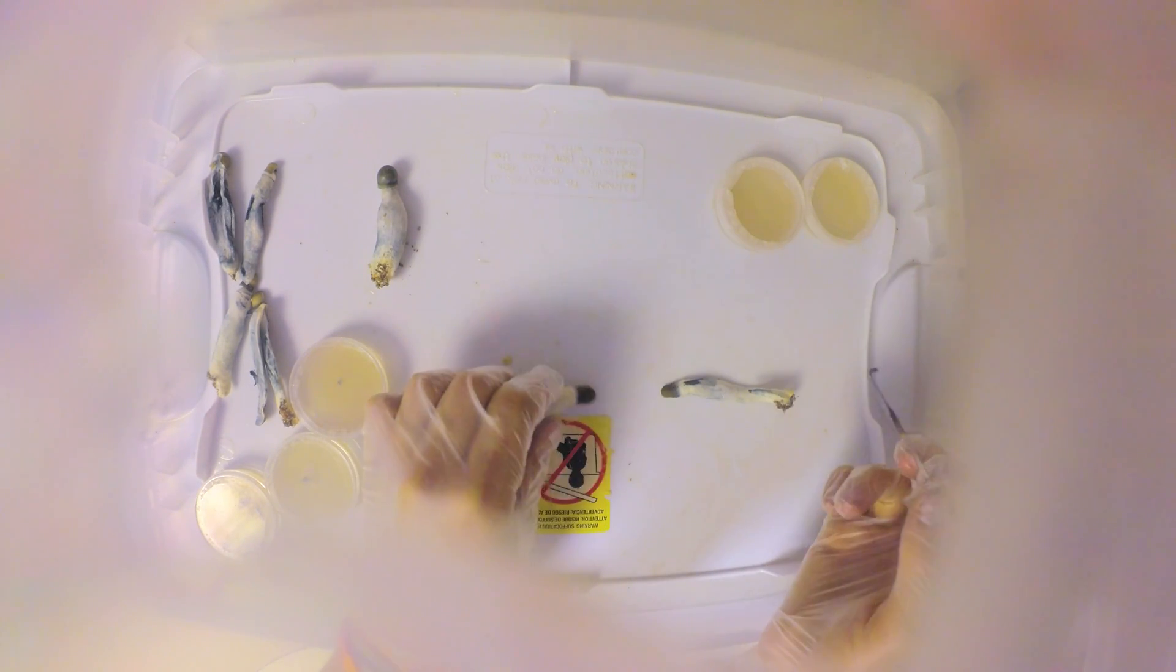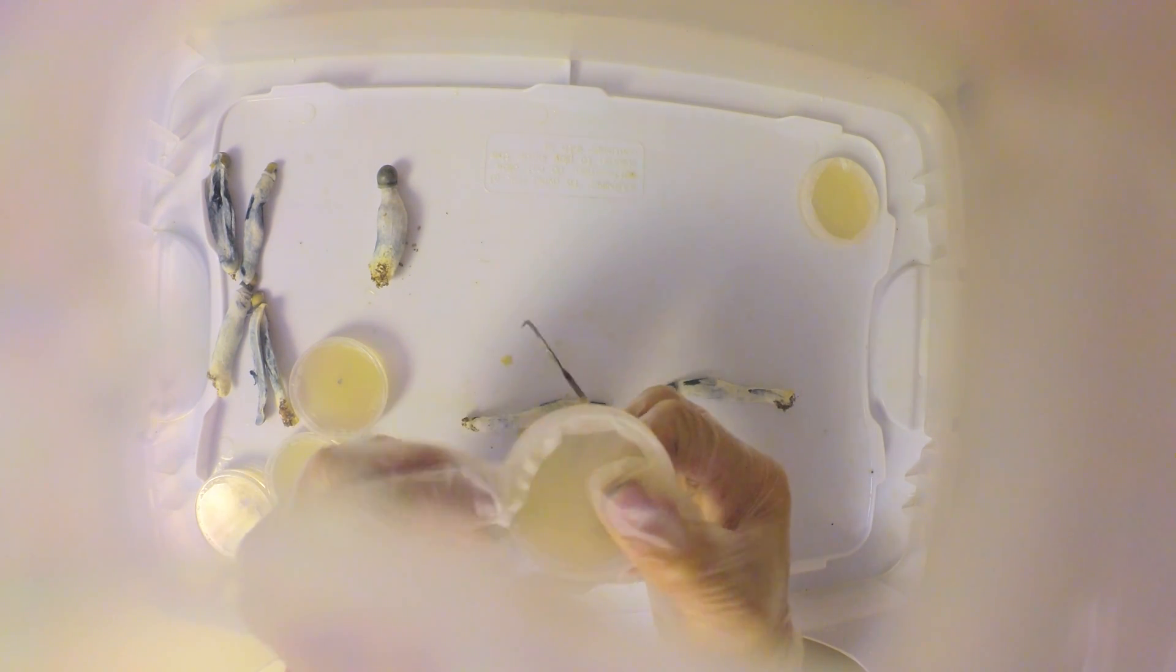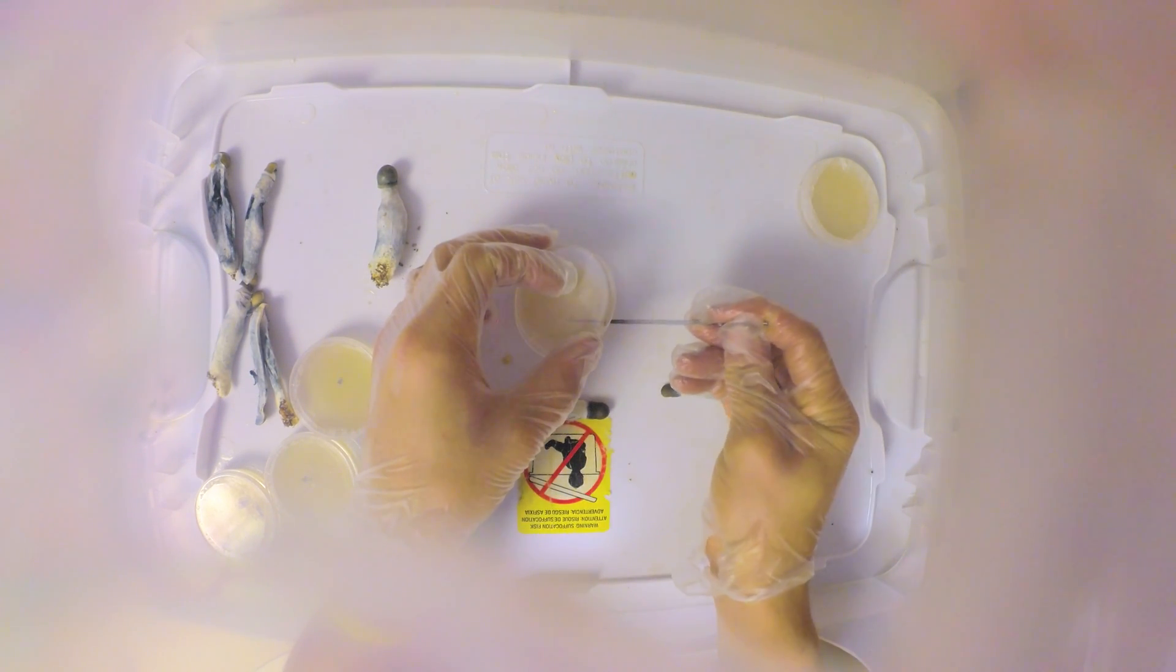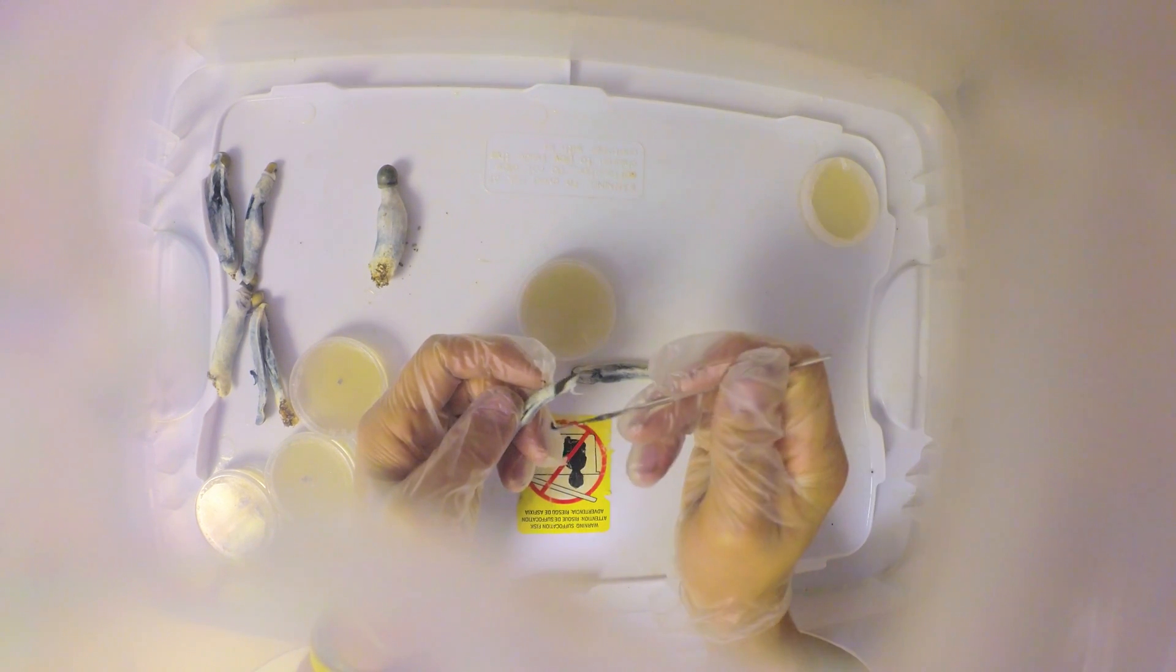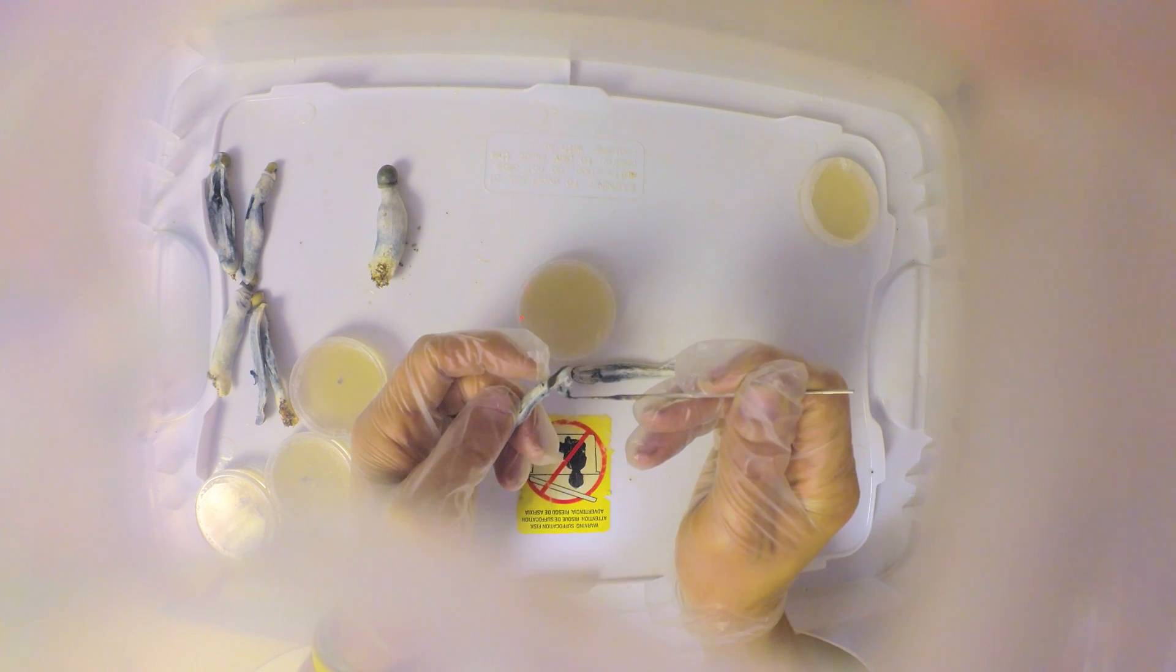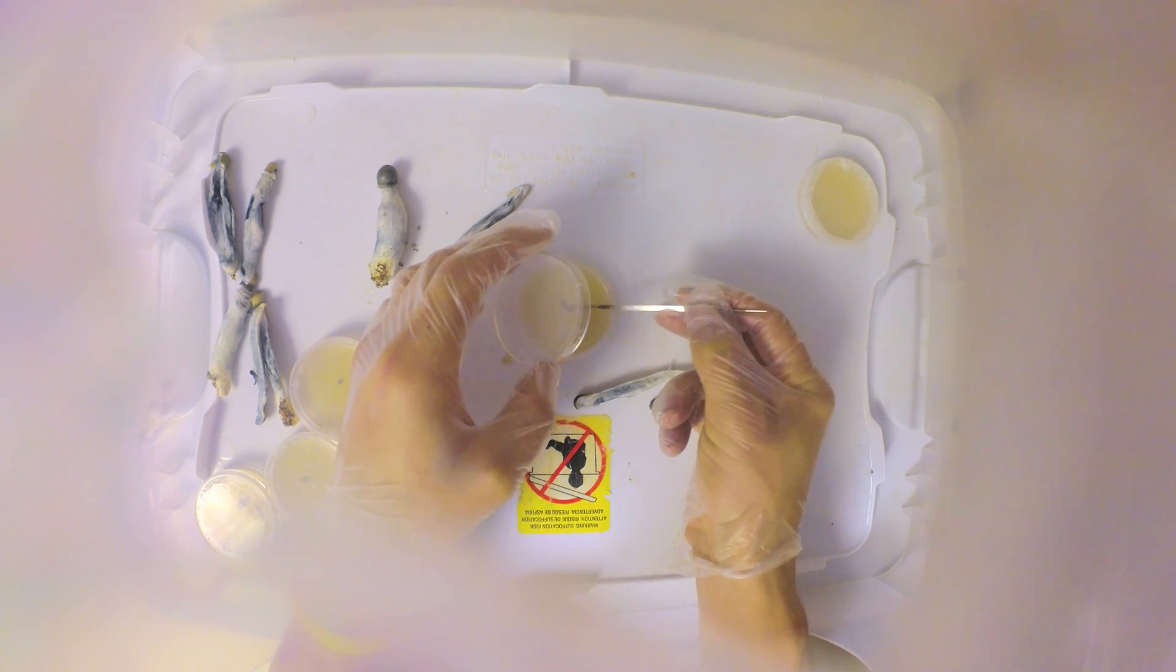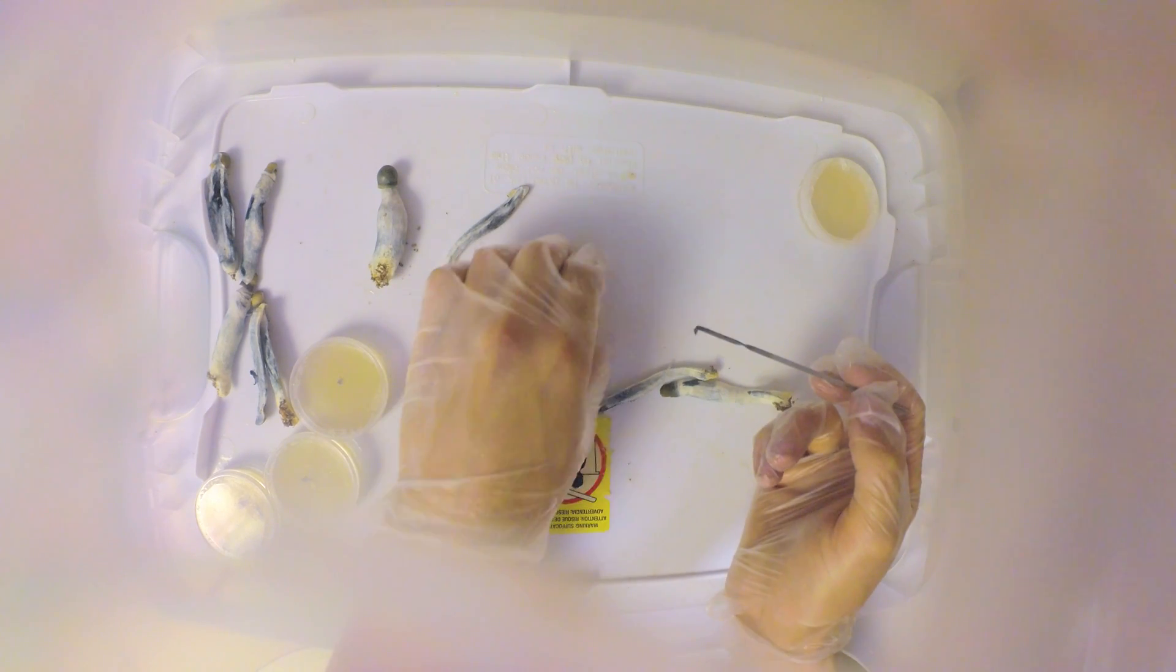I'll take two samples from this one, there's still a lot of meat left. Flame sterilize again, cool down your tool, open the mushroom and grab a sample. Notice how I never put my fingers directly over this, or I do my best not to. Nobody's perfect.